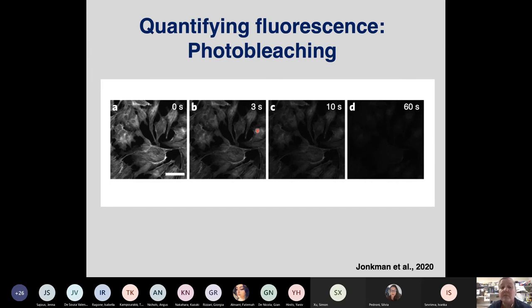And one of the problems is photobleaching. So it depends how long you take to focus your sample. If you're slow or you don't find stuff, after 60 seconds, especially if you don't use anti-fading reagent or you use the wrong mounting medium, you may not find much of your fluorescence left. And you can imagine, if you quantify this compared to this, you could come up with all kinds of rubbish.